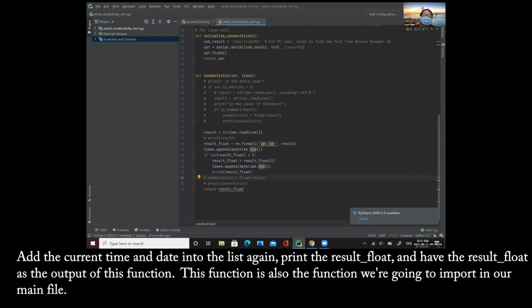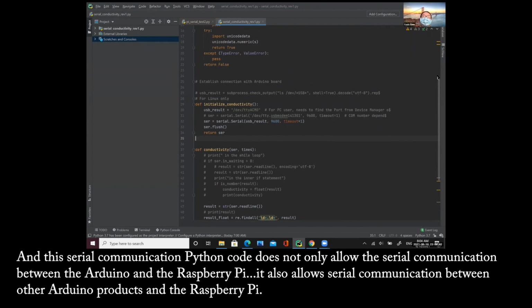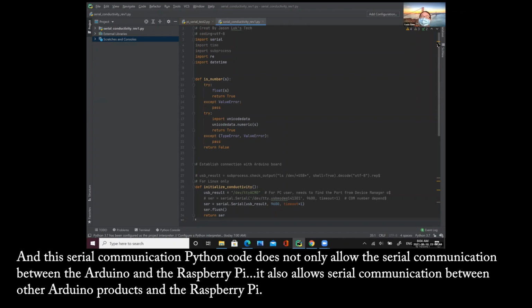Add the time, current time, and day into the list again, print the result float, and have the result float as the output of this function. This function is also the function we're going to import in our main file. And this serial communication Python code does not only allow the serial communication between the Arduino Uno and the Raspberry Pi, it also allows serial communication between other Arduino products and the Raspberry Pi.